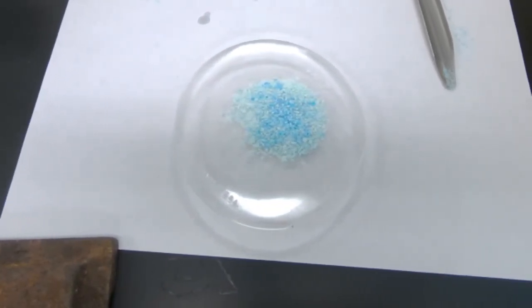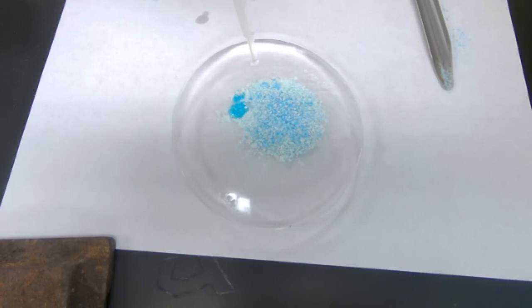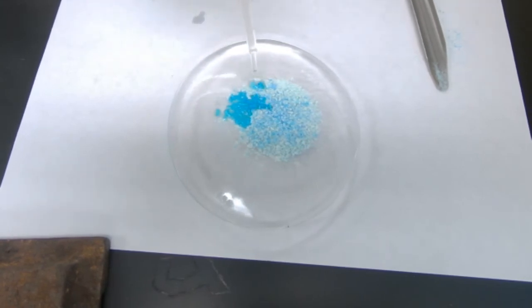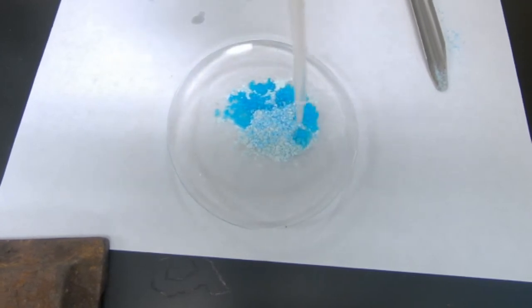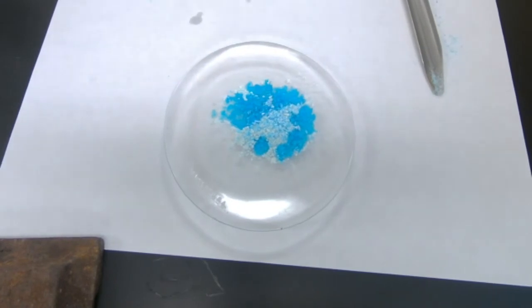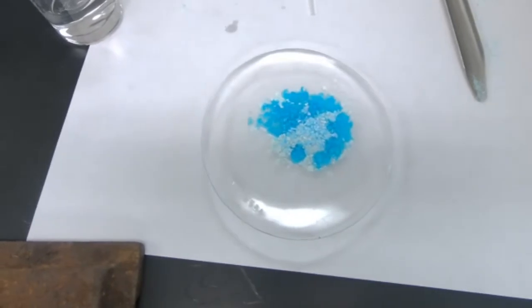This is station 5, step 3. See how it works. Ooh. Notice what I'm doing there to the edges, where it's the lightest. Well, folks, we did it. And let me transition back over.